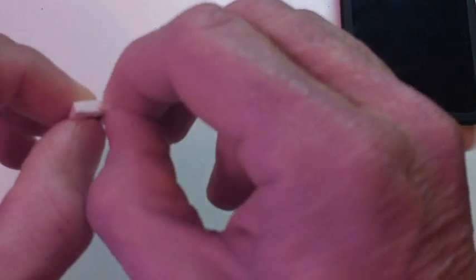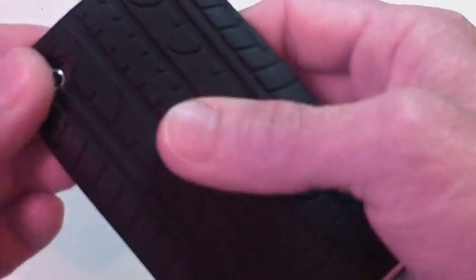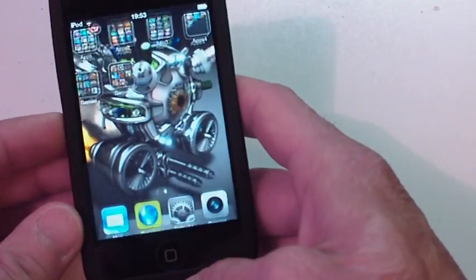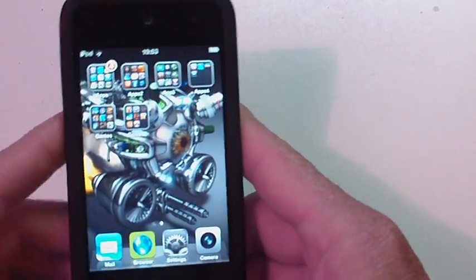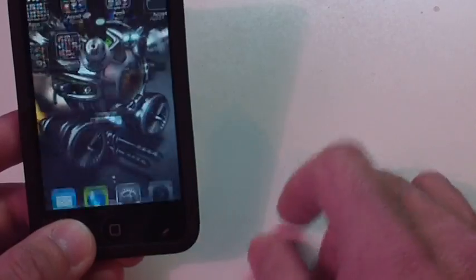I decided to make it a rubber material, since it's able to take the shape of the back of my iPod Touch. As you can see, it's not really flat. It's got a little smooth edge. Okay, this is my cover. So what you want to do with that? First of all, I want to show it's just an iPod Touch 4th generation. Open up the camera.